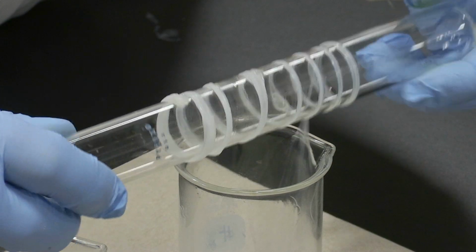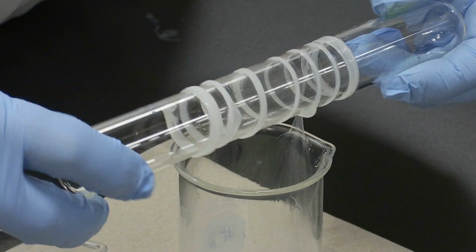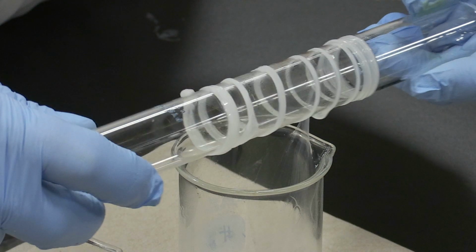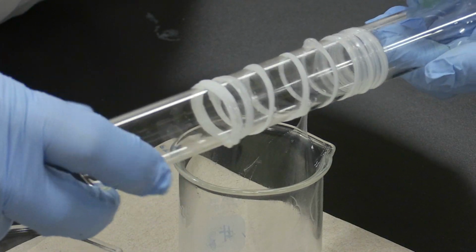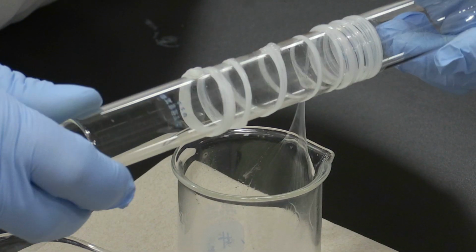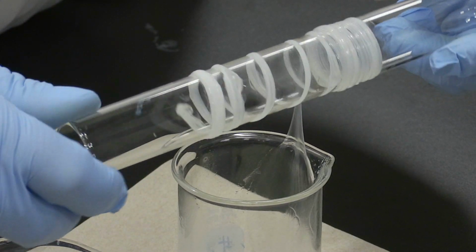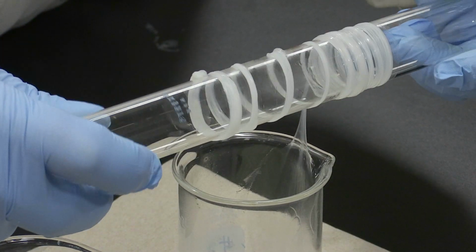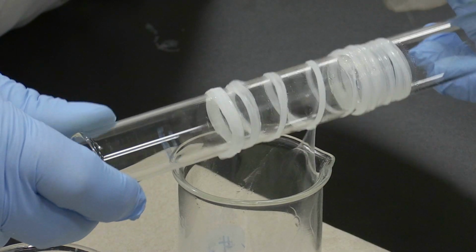Actually, in an industrial process, it's much more refined. They can control it much better. So this is laboratory nylon 6,6. And as you can see, as long as we're careful, we can just continue to make the polymer. If it breaks apart, we just restart it, pull out another segment, and restart it.